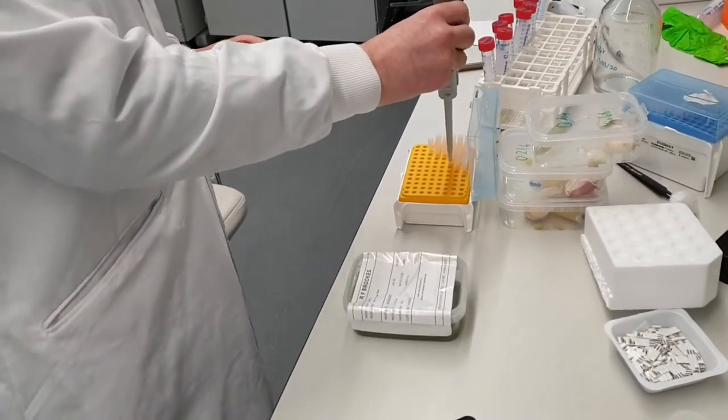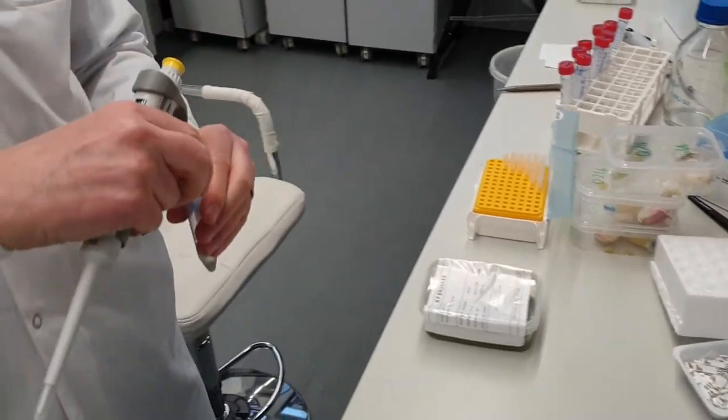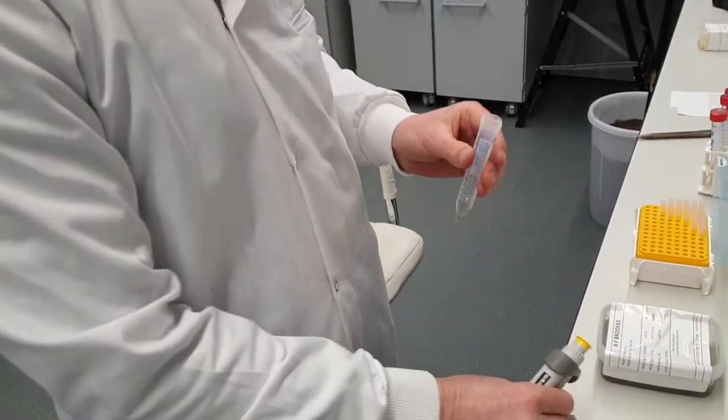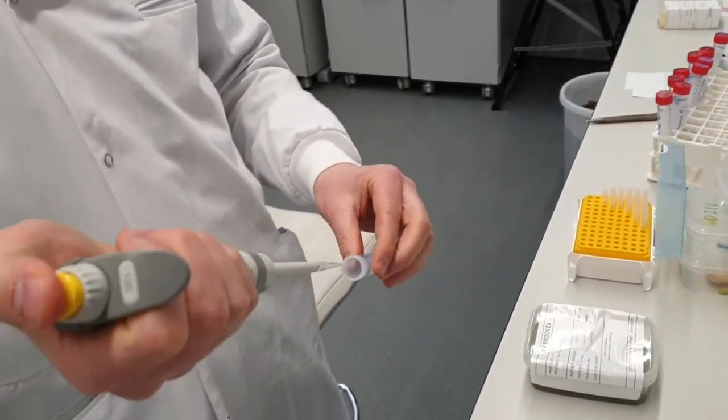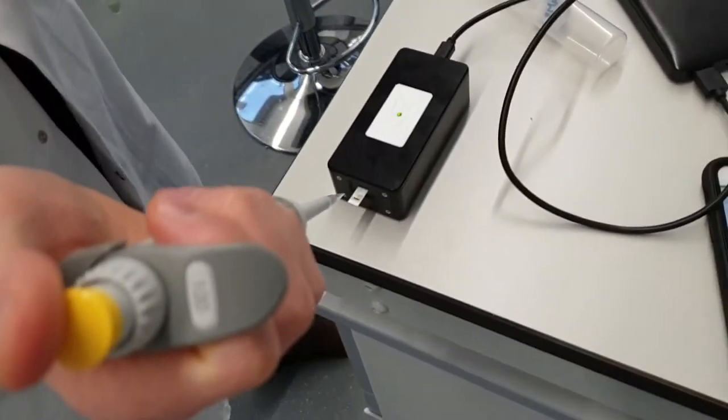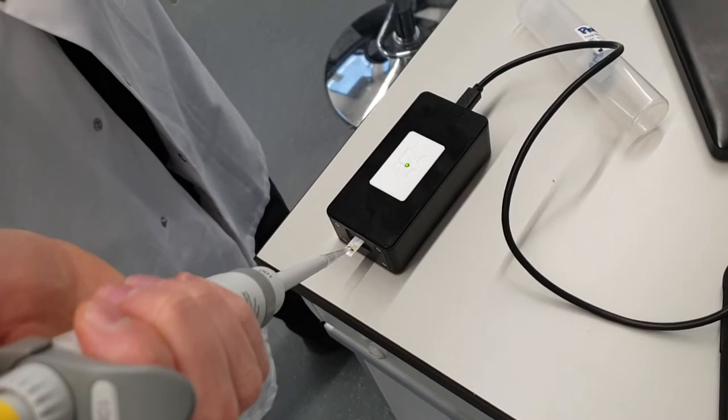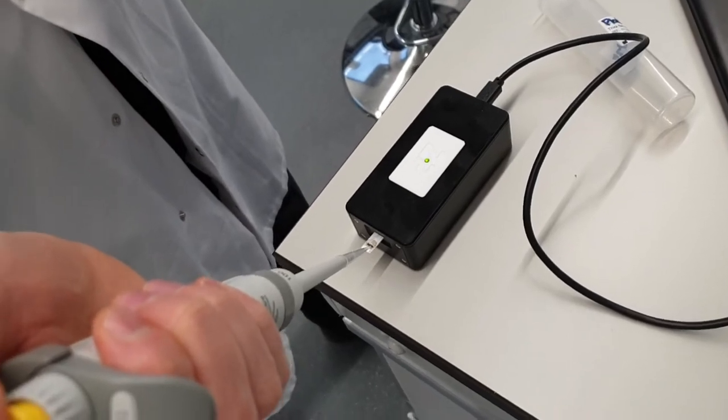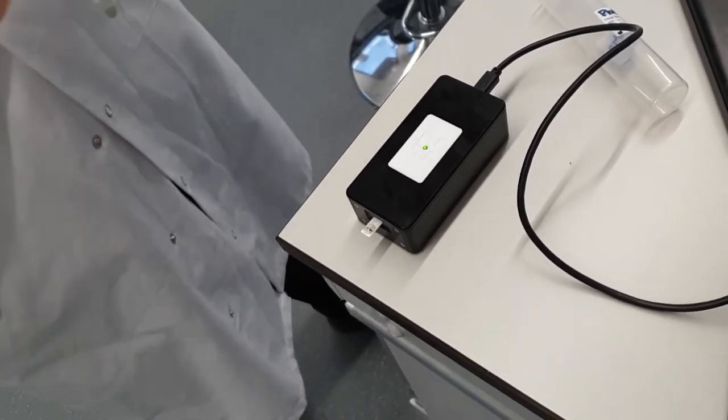Take the pipette. So I'll take just 40 microliters. Right, so we've done that.